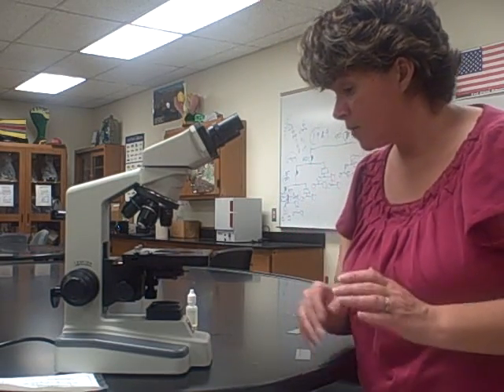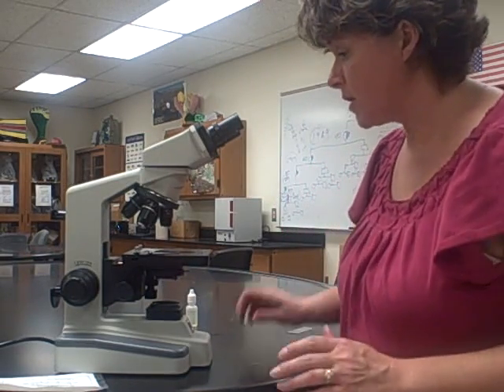During our first class meeting we went over the microscope and its use. I want to go over it again just to make sure that everybody knows the proper use of it and that we don't have any problems throughout the semester.